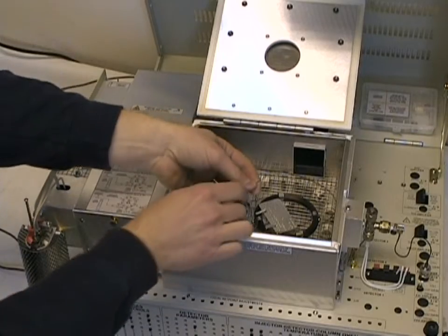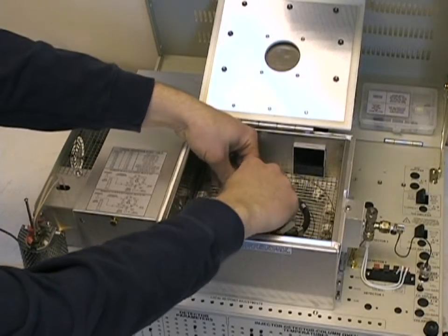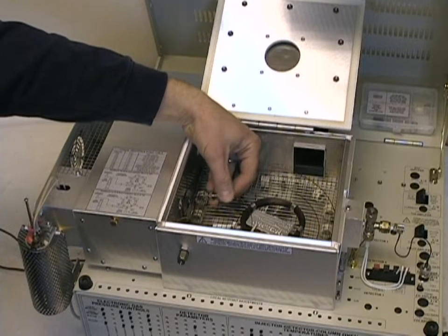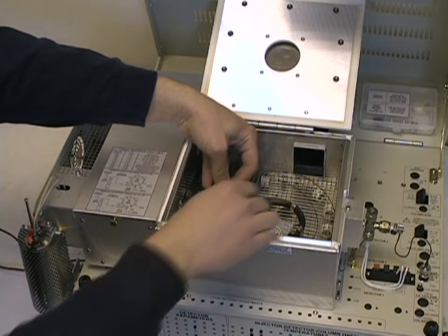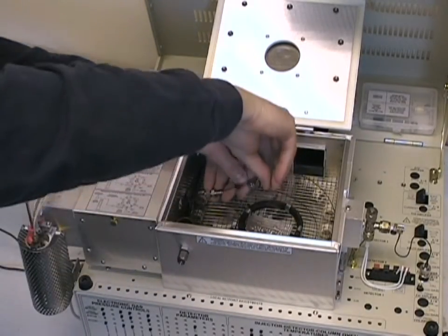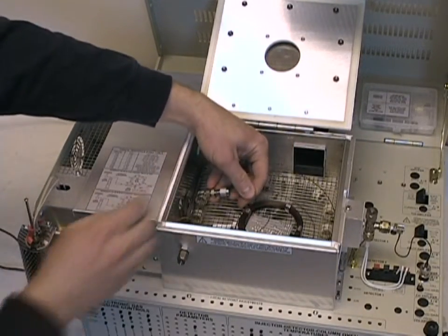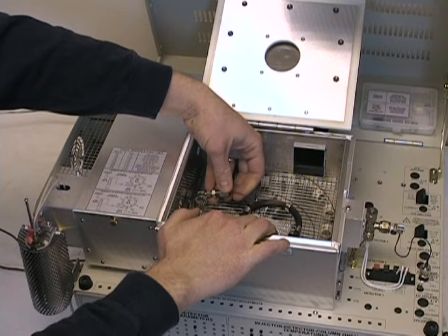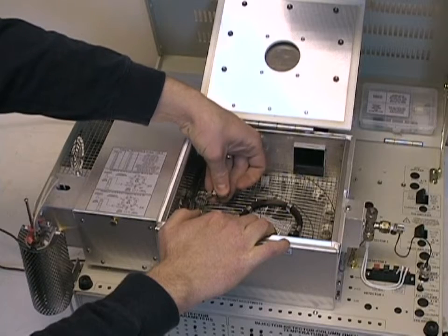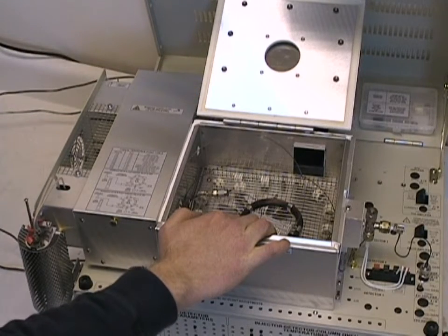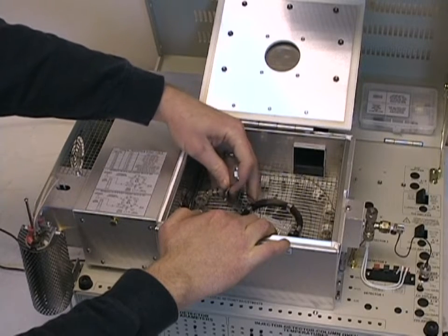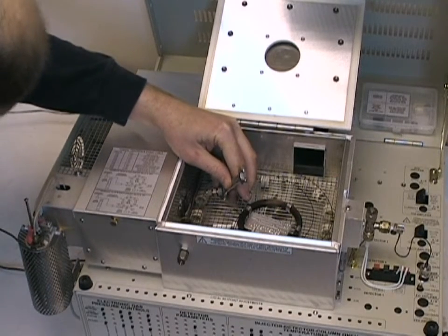Take this clean end, position it so that the column is well seated at the bottom of that fitting, then push the nut and ferrule assembly forward while pushing on the end of the column to maintain a tight fit, then finger tighten the nut, and again using an appropriate wrench, tighten it approximately ½ a turn to ¾ of a turn so that the column is securely gripped by the soft graphite ferrule.